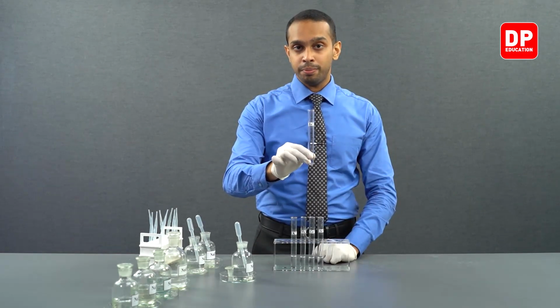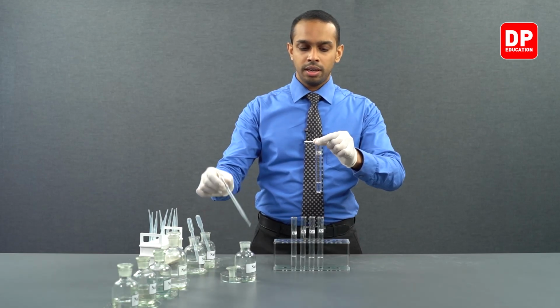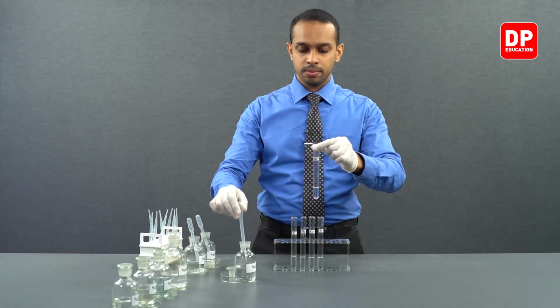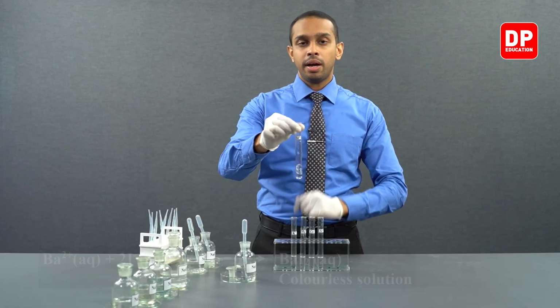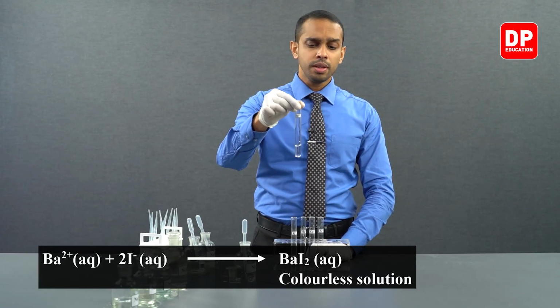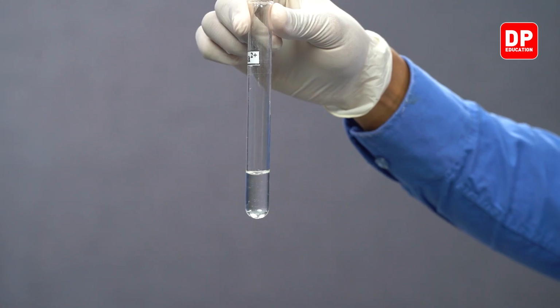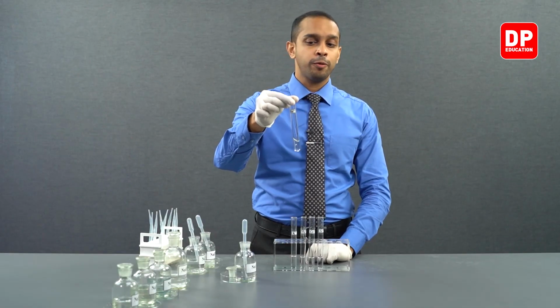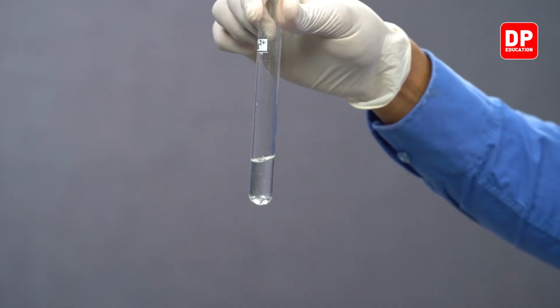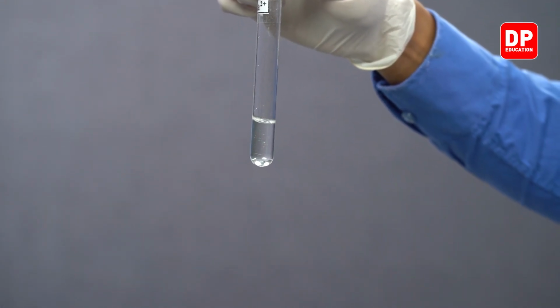Now finally we have barium 2 plus aqueous ion solution. To that, let's add a small amount of iodide ions. Barium ions along with iodide ions will form barium iodide. Barium iodide is also a soluble salt. It's a water soluble salt. So therefore, it will also not form a precipitate. As you can see, it's a clear solution, no precipitate formed.